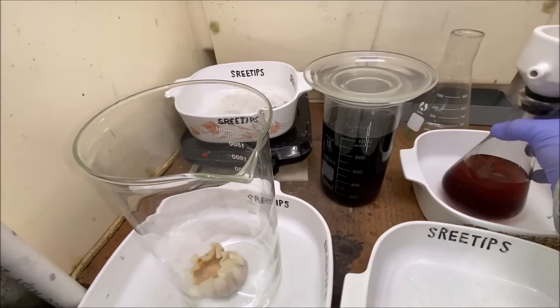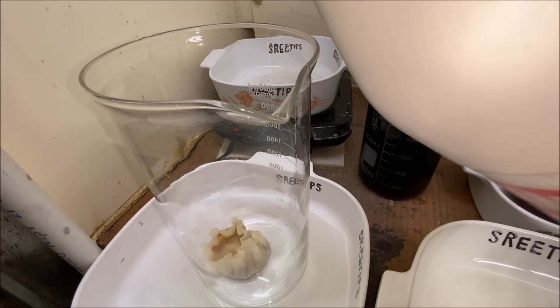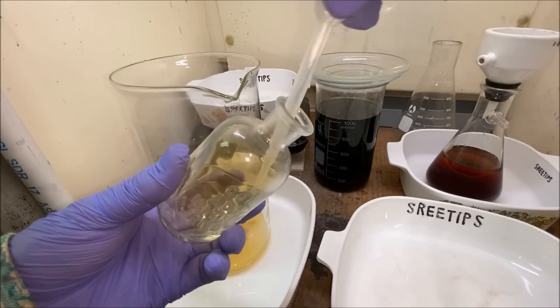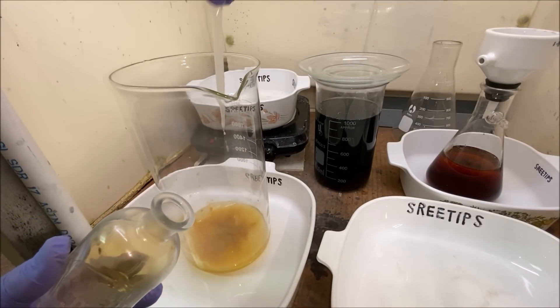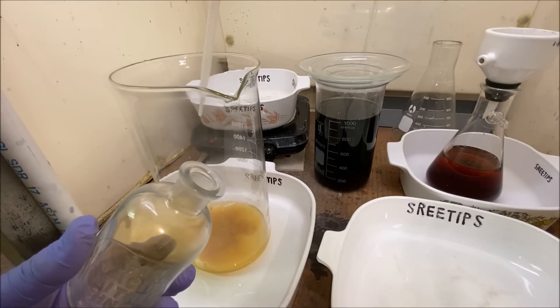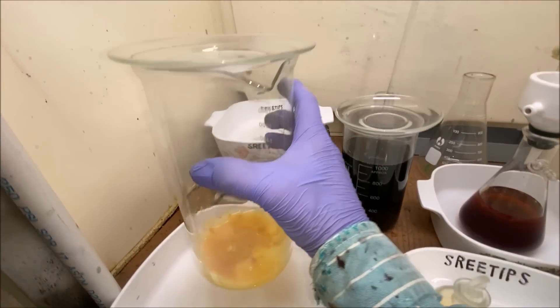I'll add a little bit of hydrochloric acid to our filter with the solids in it. Now I'm adding six milliliters of nitric acid and then we'll stir it up a little bit and put it up on the heat and let this dissolve.